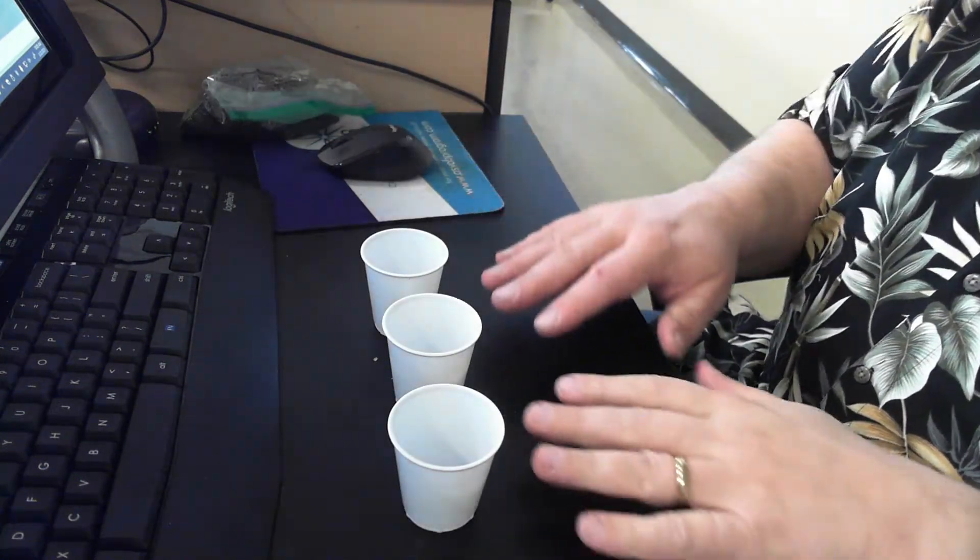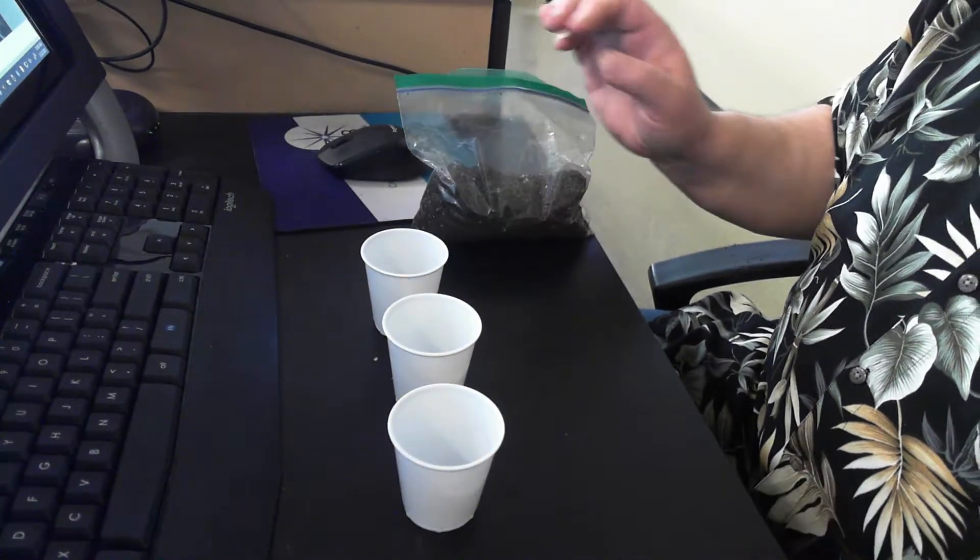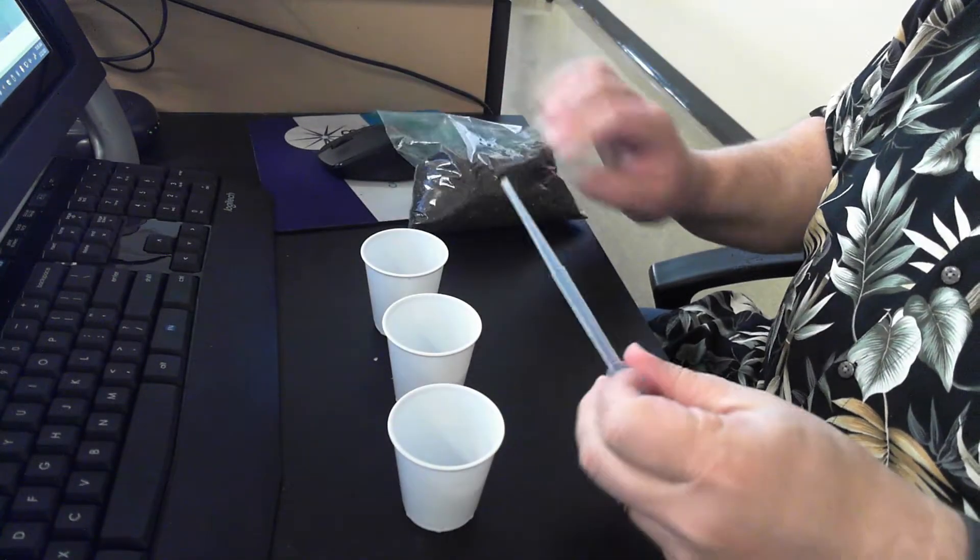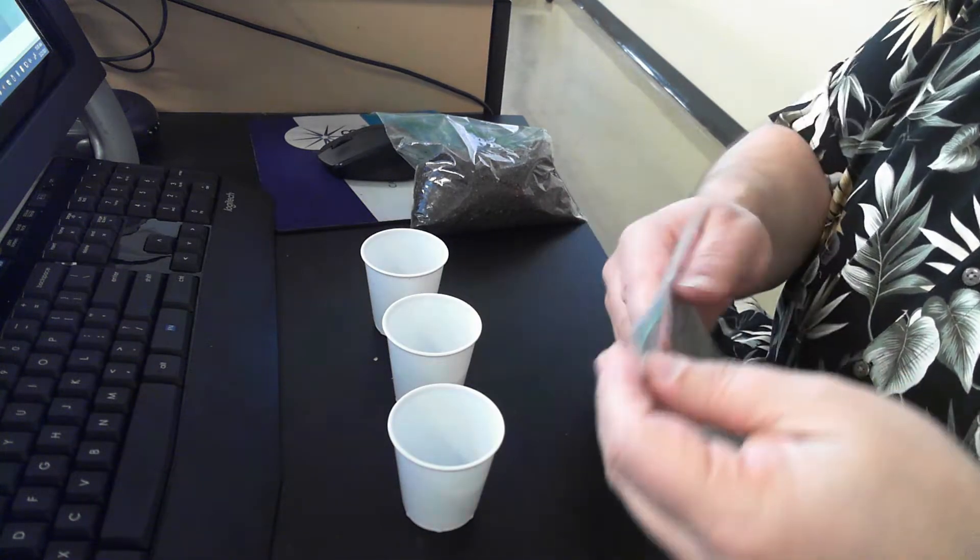All right, so we've got our workspace here. I've got my three cups, I've got my dirt, I have a pipette to handle the watering with, and I have my seeds.